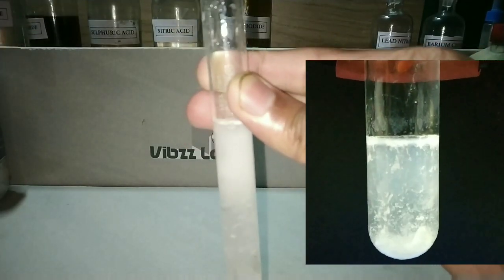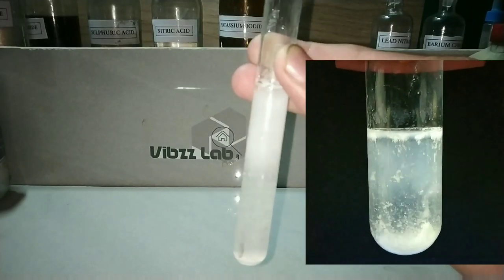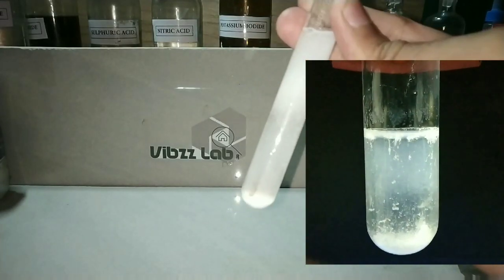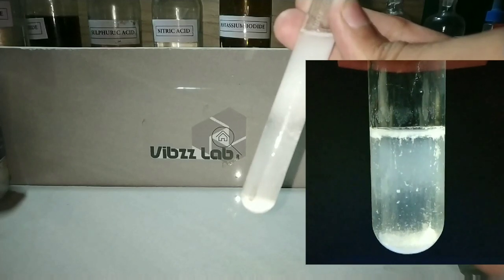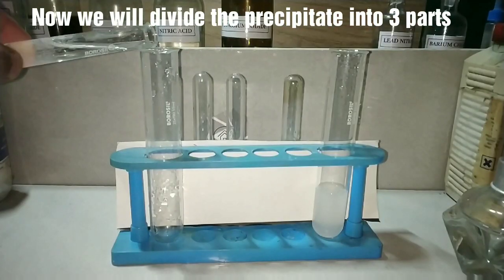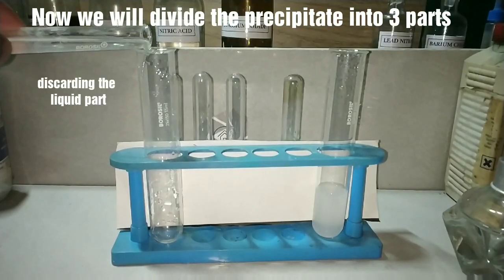The white precipitate formed is heavier, hence it settles down at the bottom of the test tube. Now we will divide the precipitate into three parts.